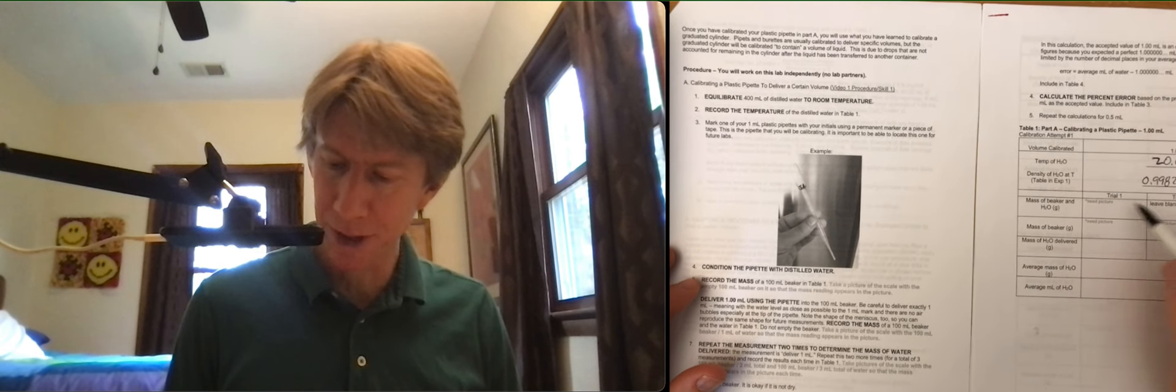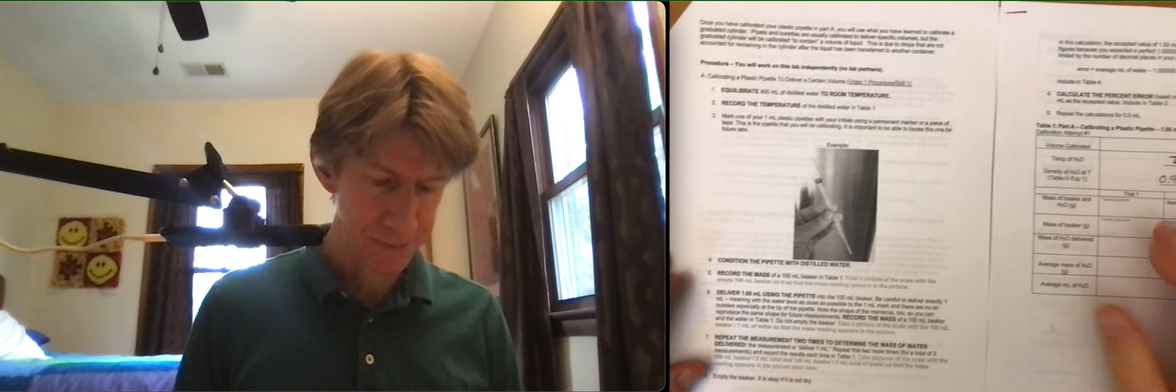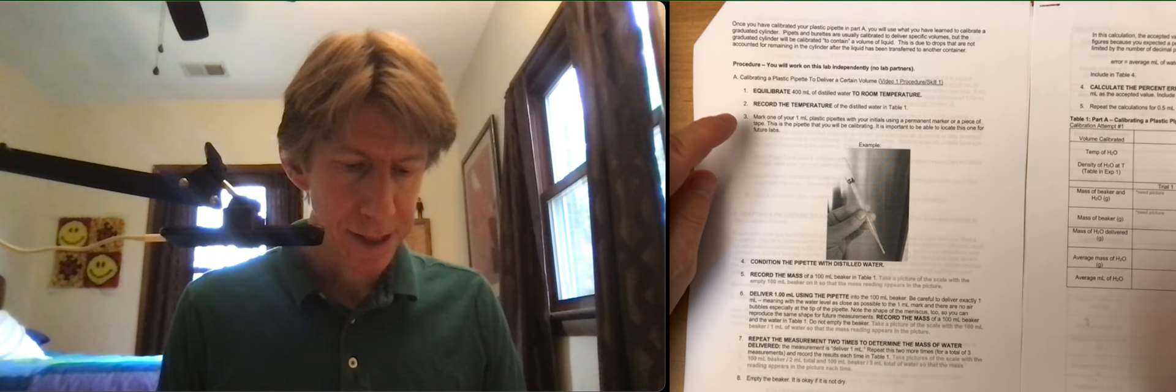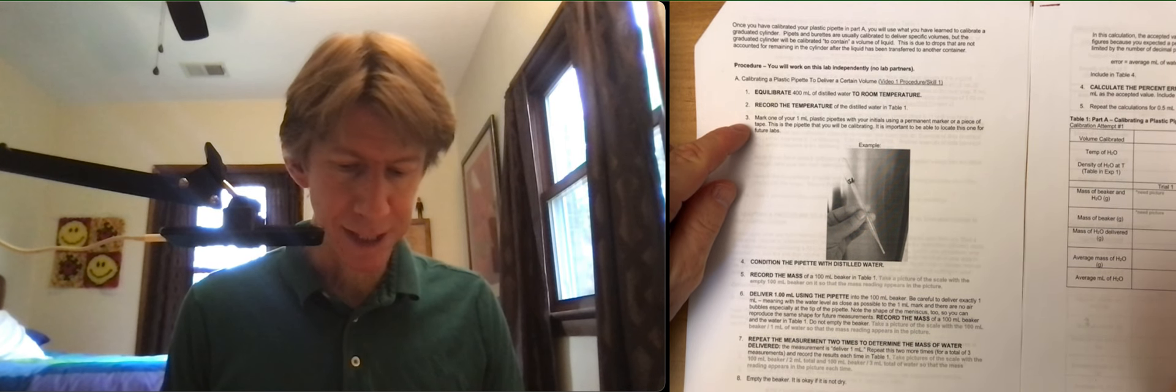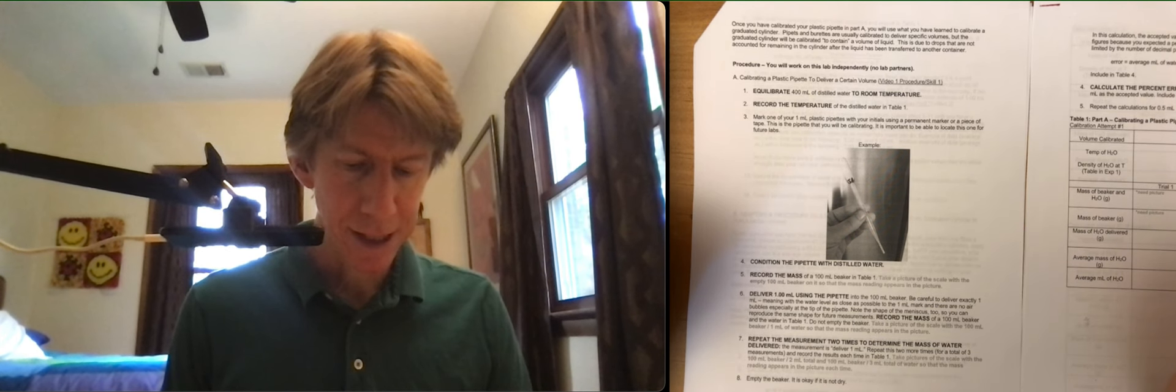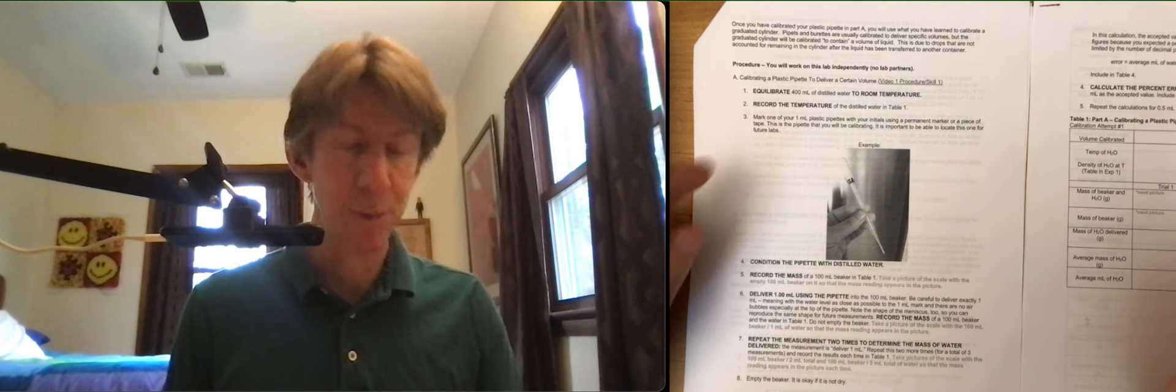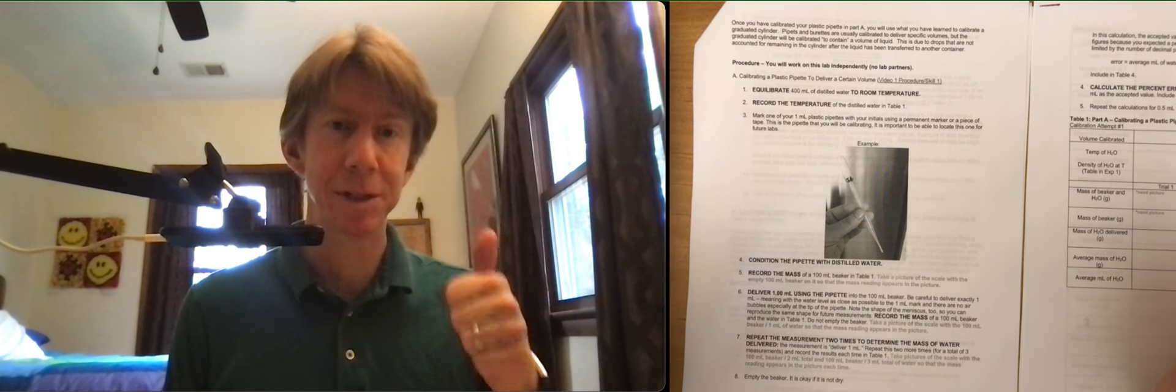You'll notice that in this table there's a bunch of need picture, need pictures. Mark one of your one milliliter plastic pipettes with your initials. Done. And we will need this pipette for future labs. So please do it.